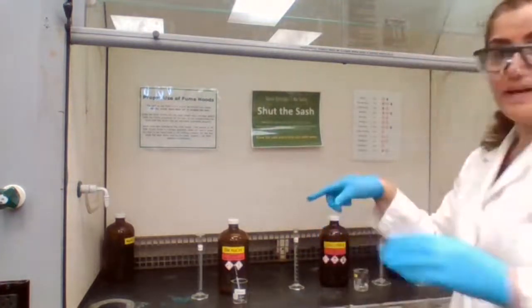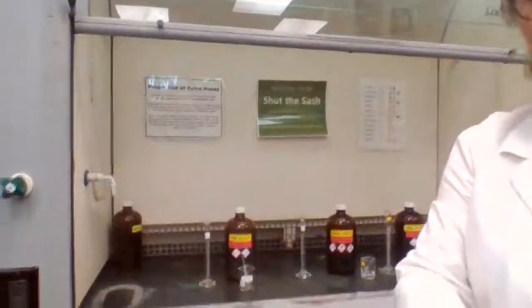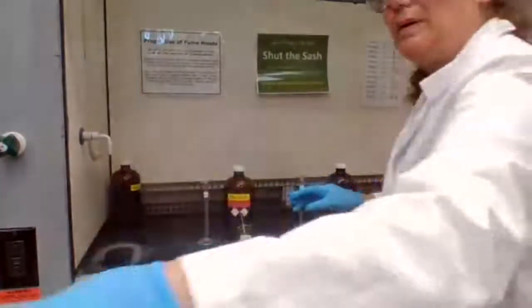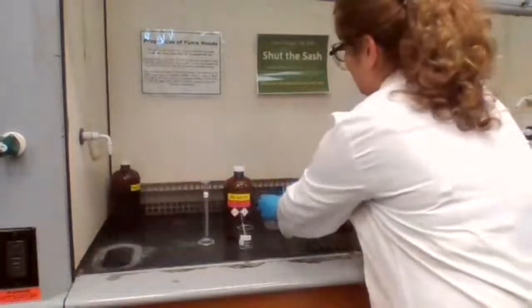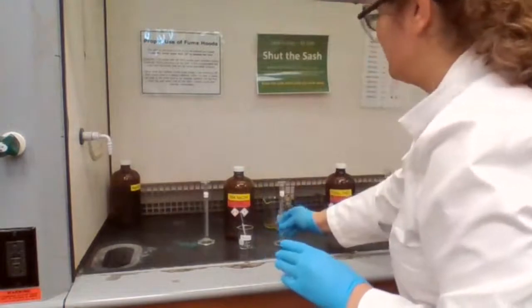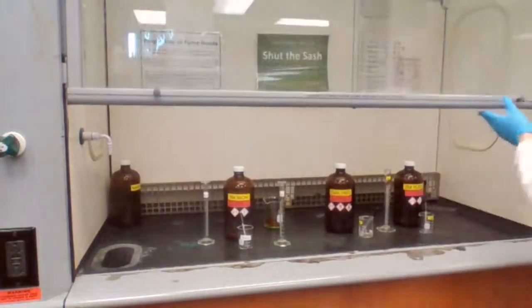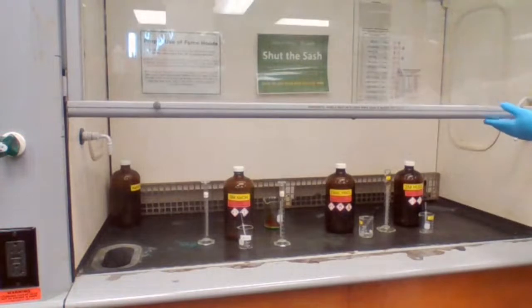Copper is not a very reactive metal, but nitric acid is very strong. So when I add the copper to the nitric acid, you will see now that it's going to generate fume.